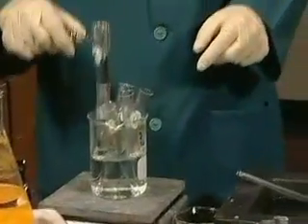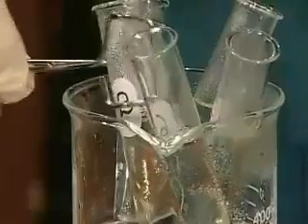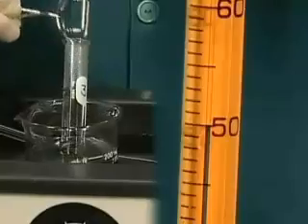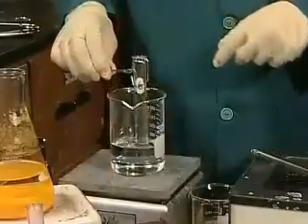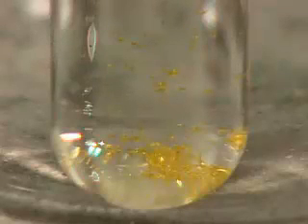One sample of the hot saturated solution is placed in a boiling water bath that remains at 97 degrees Celsius. And 3 are placed in constant temperature water baths at 70 degrees Celsius, 50 degrees Celsius, and 25 degrees Celsius respectively. Another sample is placed in an ice water bath at 0 degrees Celsius. A 6th sample is allowed to slowly change temperature to room temperature. What is observed in the test tubes that cool?